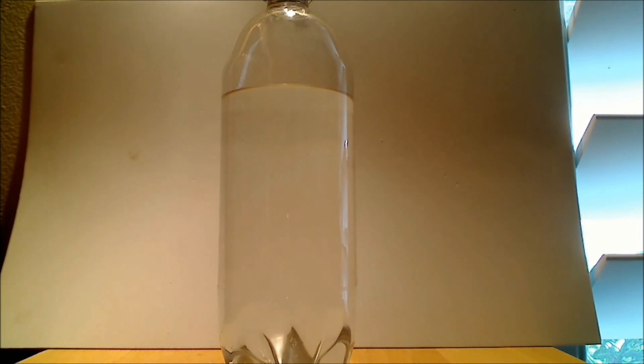Let me say while we're waiting that this liquid in there is a mixture of isopropyl and water and one other ingredient. Isopropyl and water are completely miscible with one another.